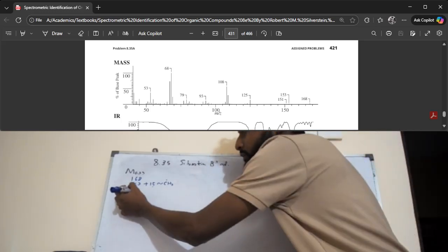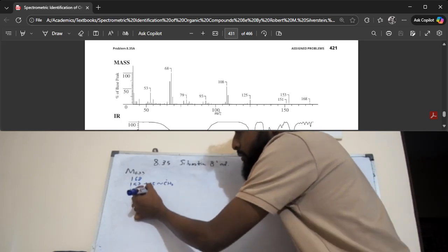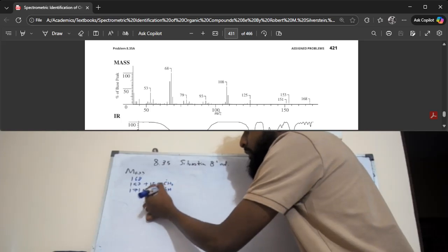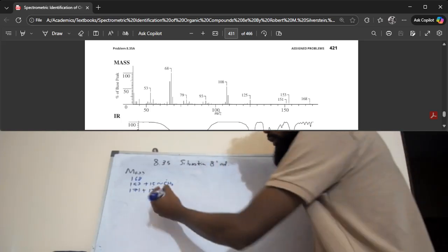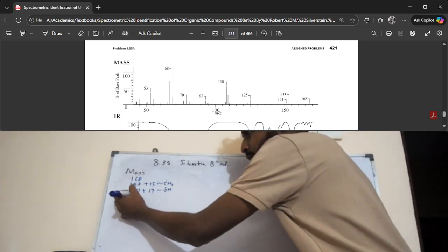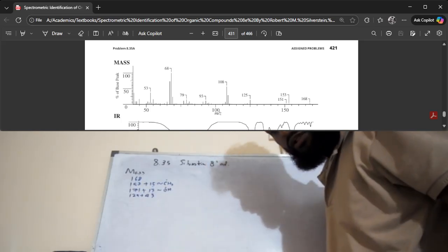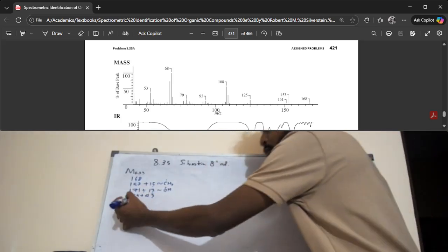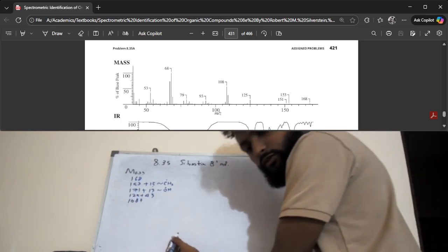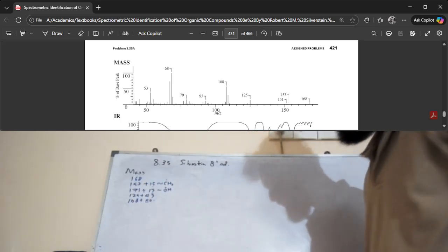There is a peak at 151, and it's plus 17. So that may be an OH radical that got removed. Maybe. There's 125, plus 43. I don't know what this is. 43 is a particular peak. If you look at the mass spectrum note, you'll be able to notice something in that value range. And plus 60, I'm going to stop it there.